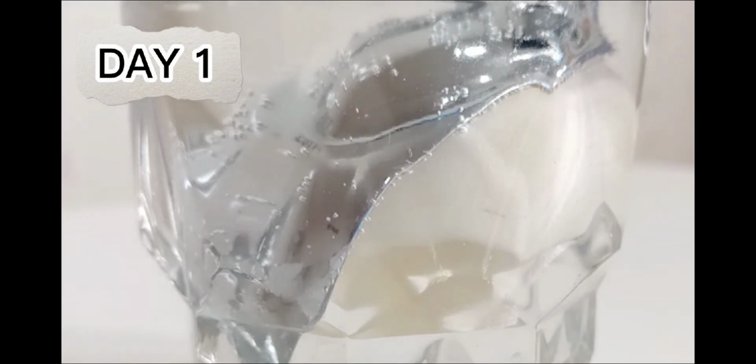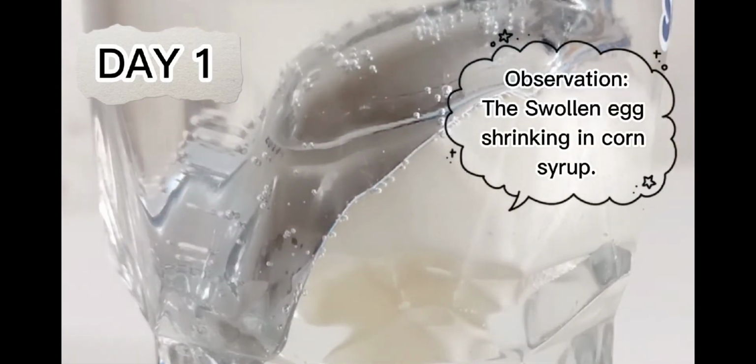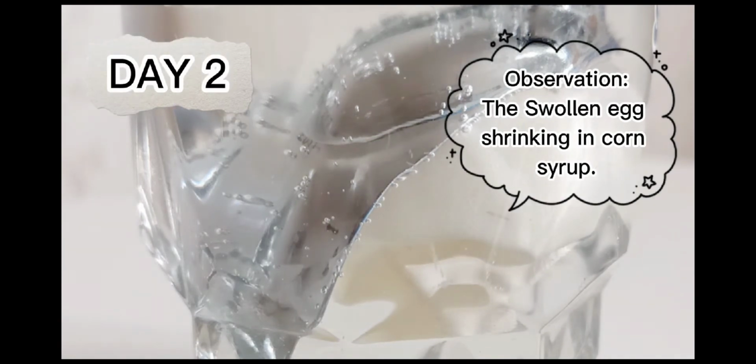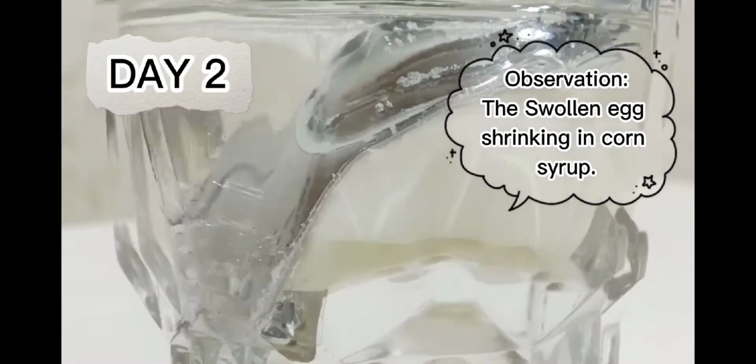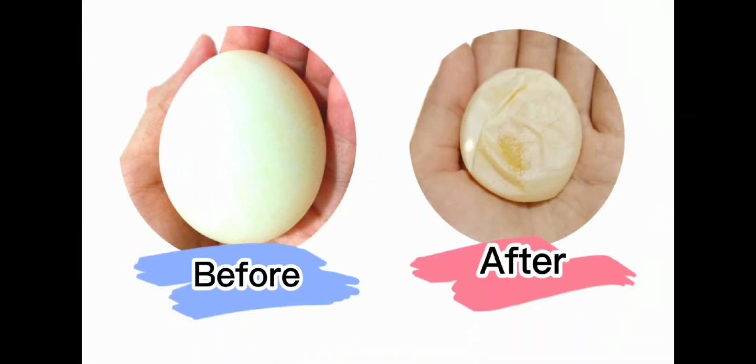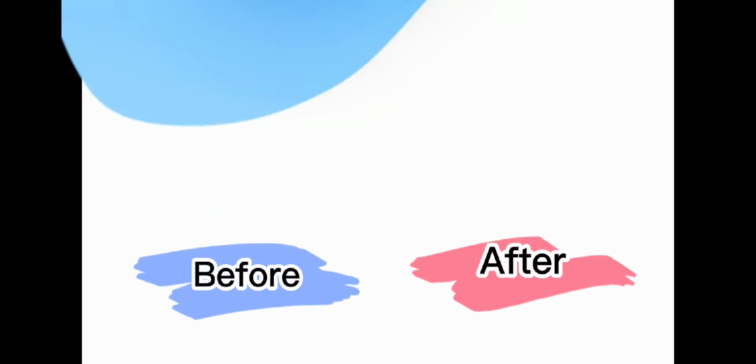The spoon is used because the egg naturally wants to float. When it floats, the surface of the exposed membrane may harden and even cause this stage to become much slower. Once the stage is complete, pour out your corn syrup and give your shriveled egg a rinse. As you can see, the size of the naked egg after is much smaller than before.